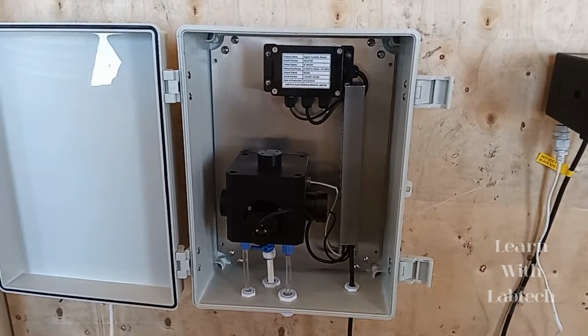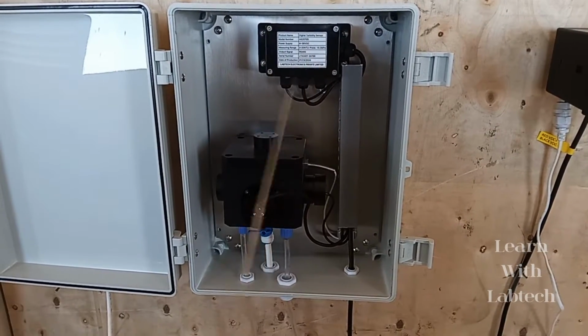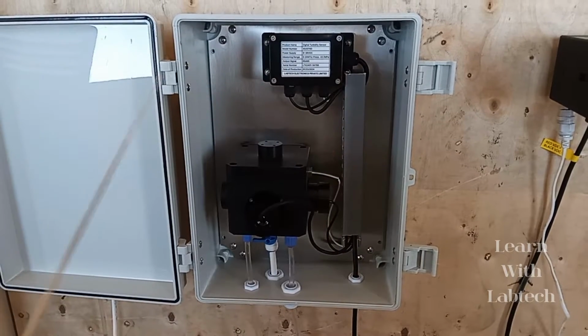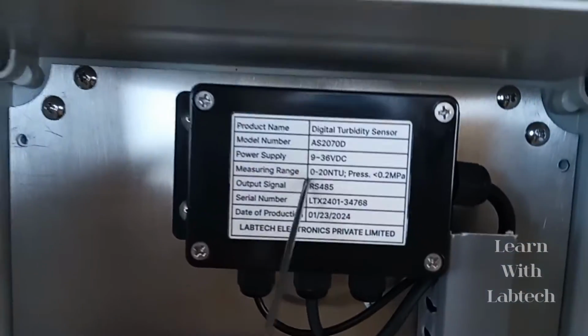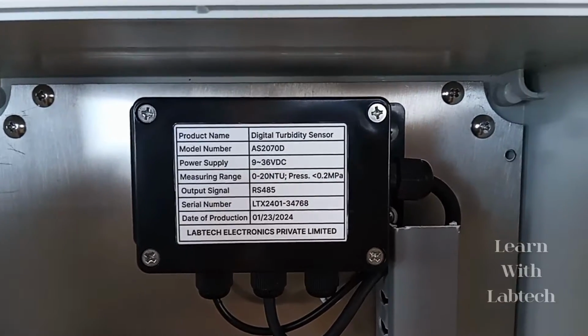Conditioning unit. The measurement principle is the right angle scattering method. That is, it measures the intensity of light scattered at 90 degrees to the incident beam. As I have told, it is measured in NTU, that is nephelometric turbidity units. The measurement range is 0 to 20 NTU for this particular turbidity sensor.